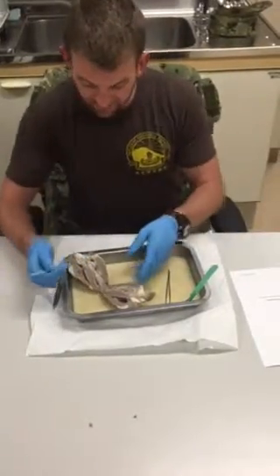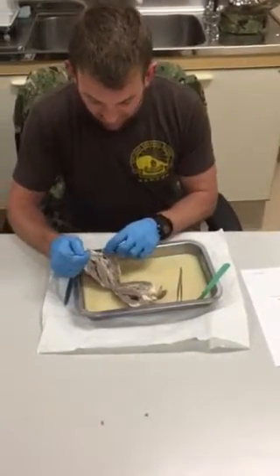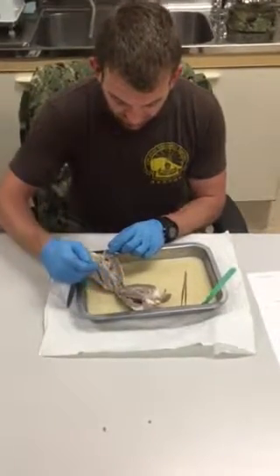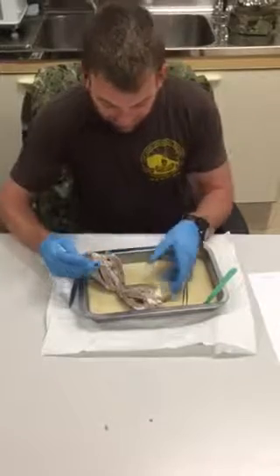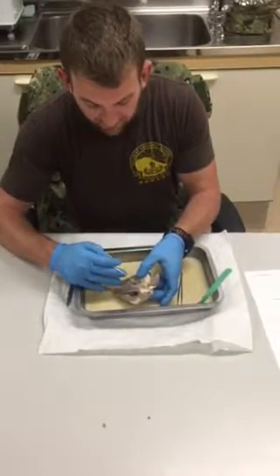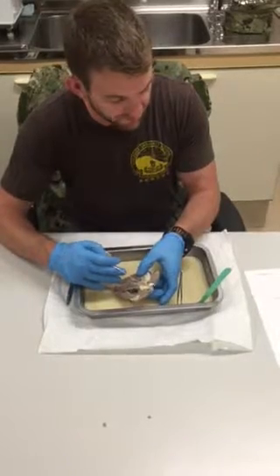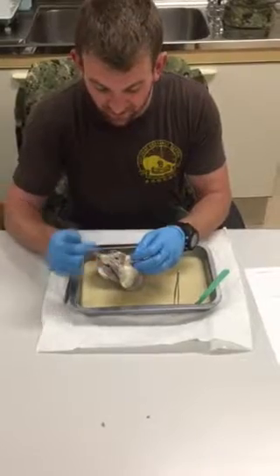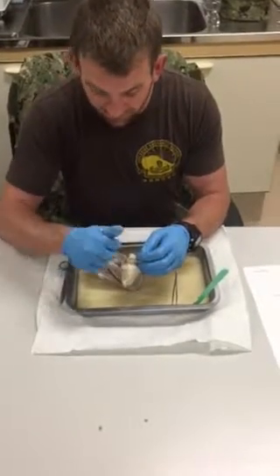Continuing on the left hand side, between the atrium and the ventricle, we have the bicuspid valve, as well as the left ventricle located here. We also have the aortic semilunar valve located at the top of the left ventricle, and then located posterior to the pulmonary trunk, we also have the aorta.